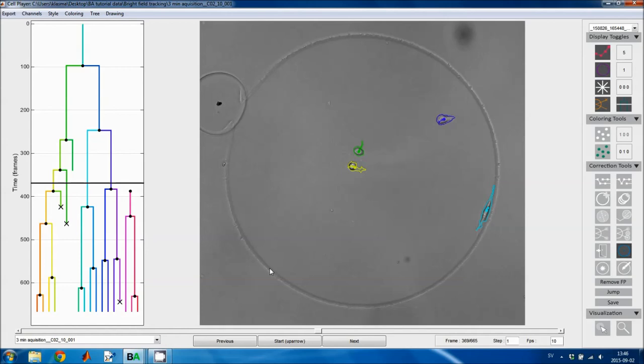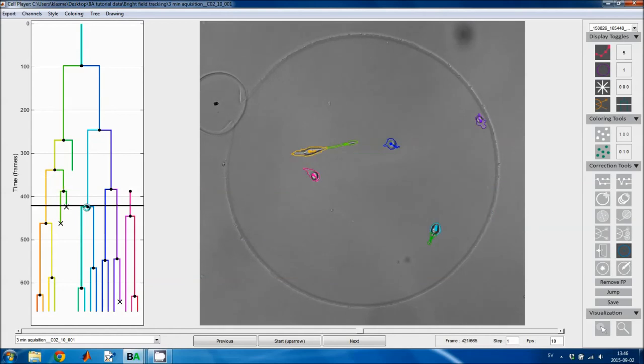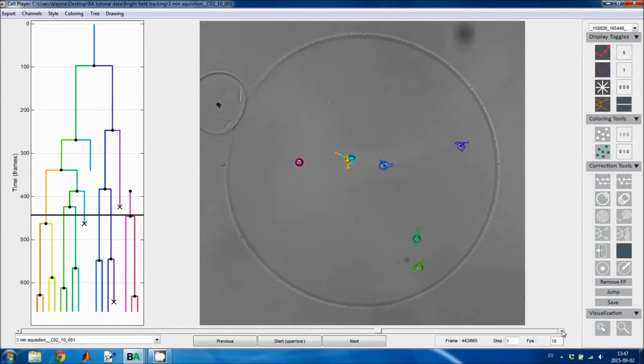The next tool is used to change the time point when a cell divides. So here is a cell division, or maybe I'll use this cell division to show it. This one seems to be at the right point in time, but if I wanted it to occur earlier, here for example, I click on it here, and then I move the mitotic event to this frame. I can also change it so that it occurs later. If I want it to occur here, I click on one of the daughter cells, and then I move the mitotic event.